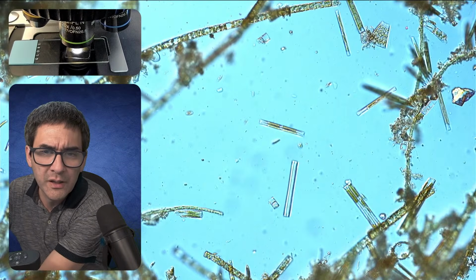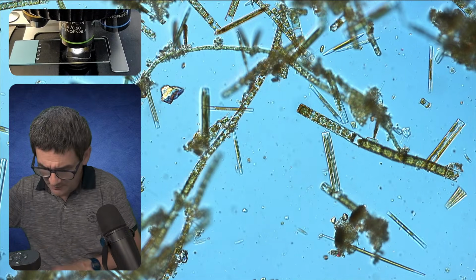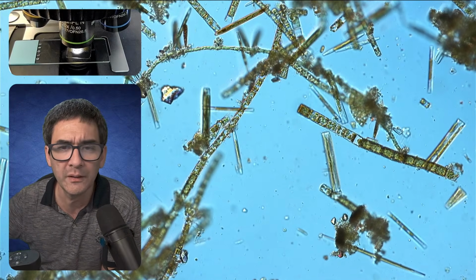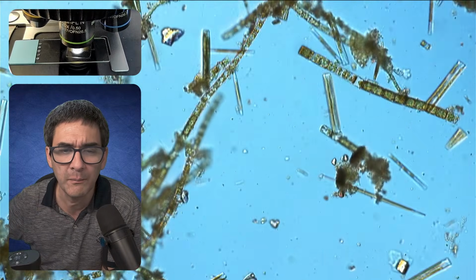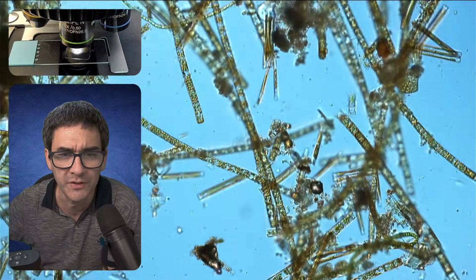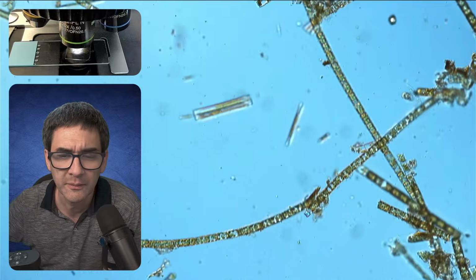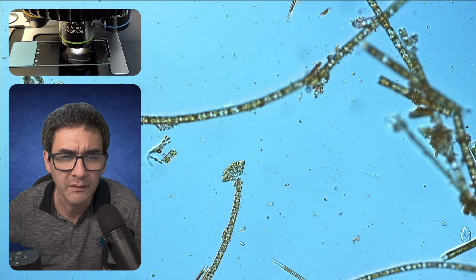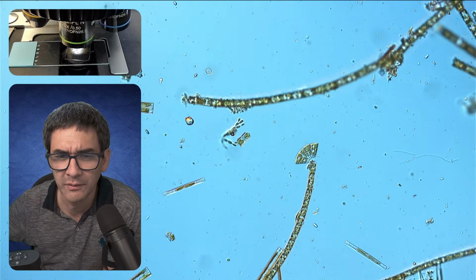Yeah, this is actually something that we can see quite often: in water samples where the water is moving or flowing, you often don't see so many moving microorganisms because very often they're simply flushed away. Okay. Let's have a look at a few of those here.